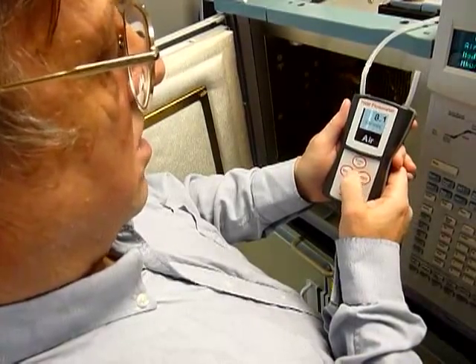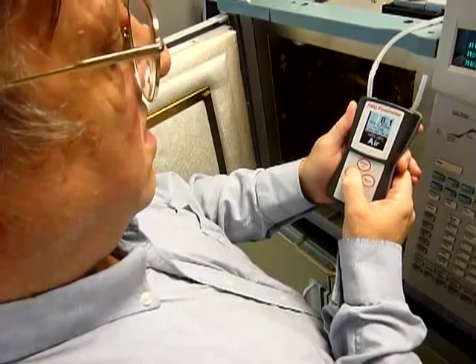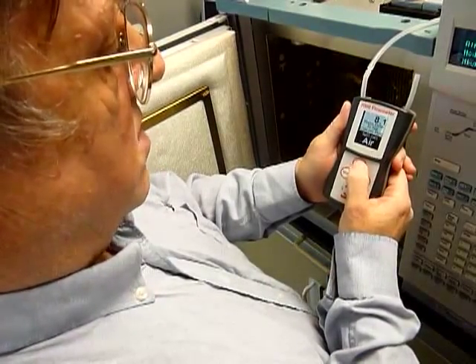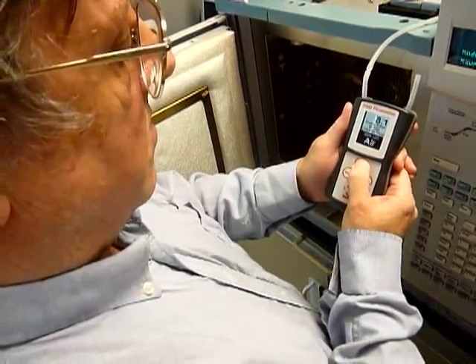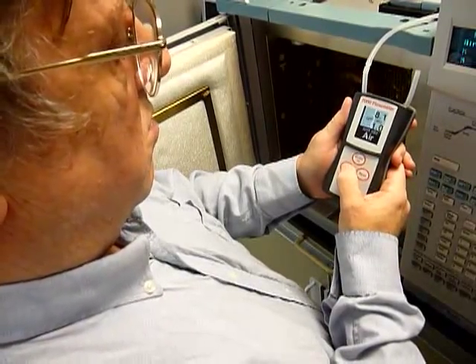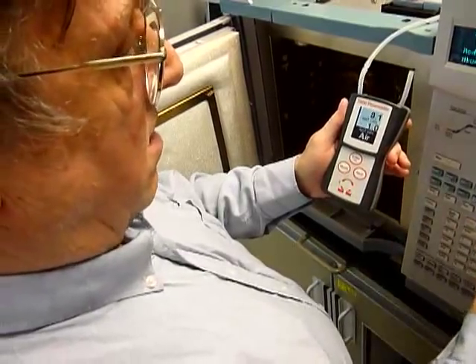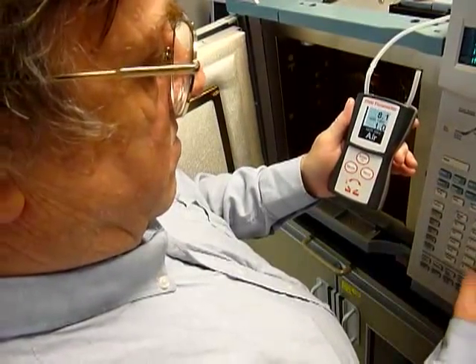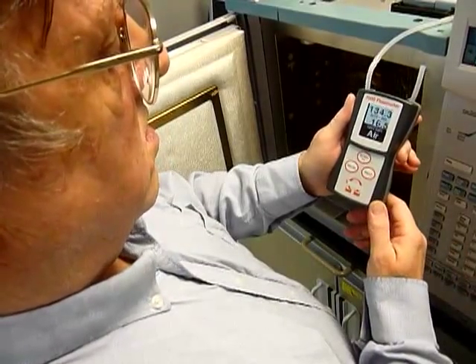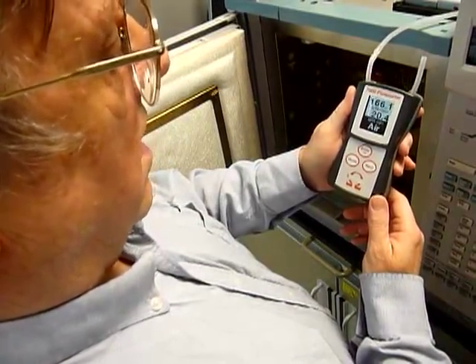To measure a split flow, press the mode key and then press enter when your column flow is stable. If you then move your tube to the split vent and check the flow at that point, the split ratio is automatically calculated.